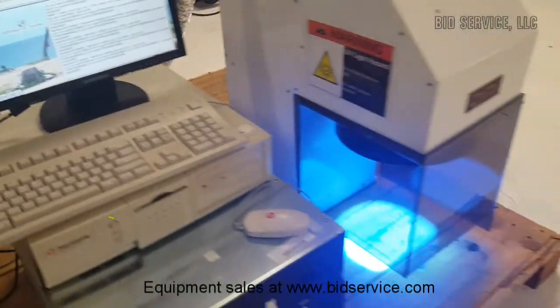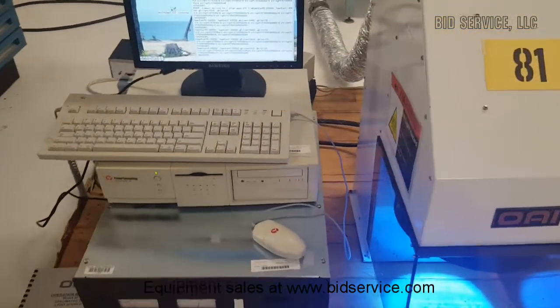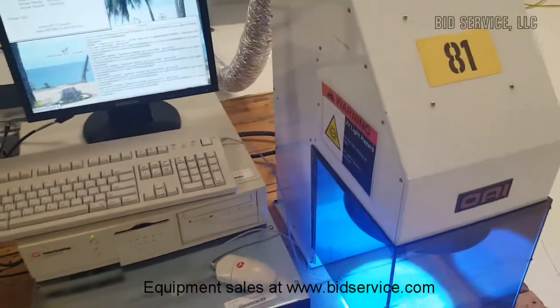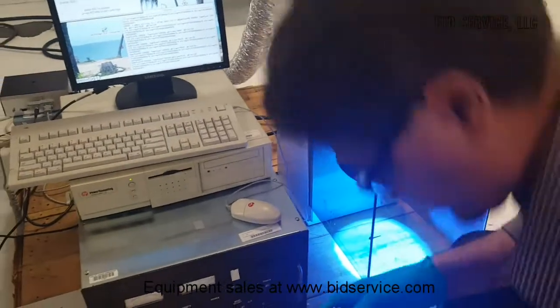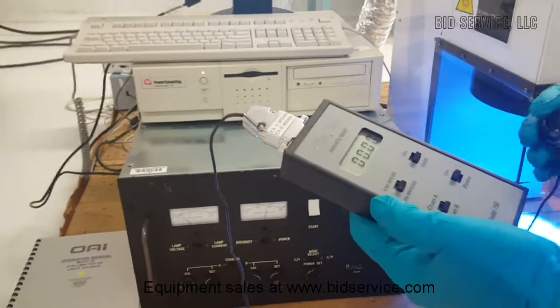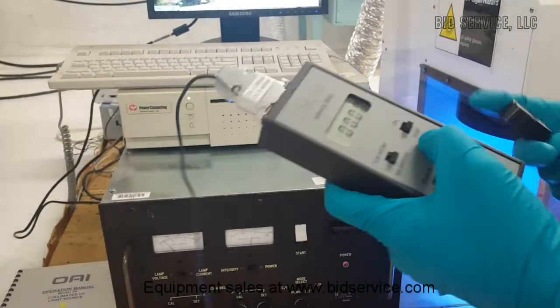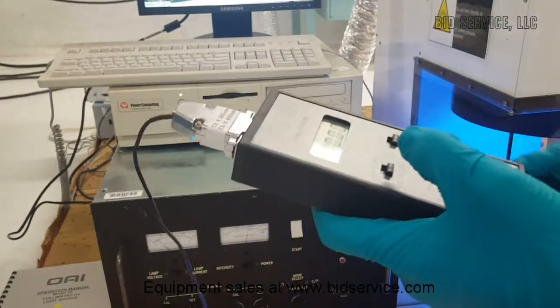I'm going to show some readings here, the energy levels of this unit. I have a meter here with a 365 nanometer detector and a 405 nanometer detector. This detector will not be included with the machine.